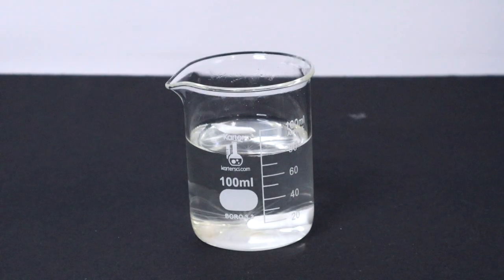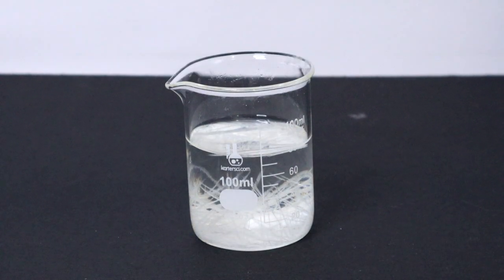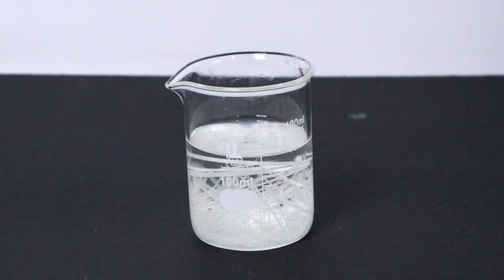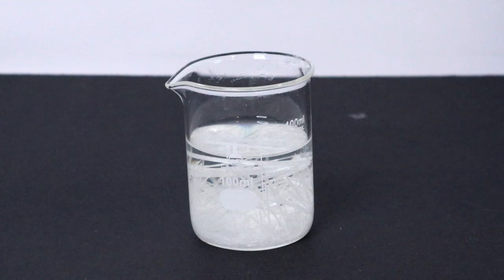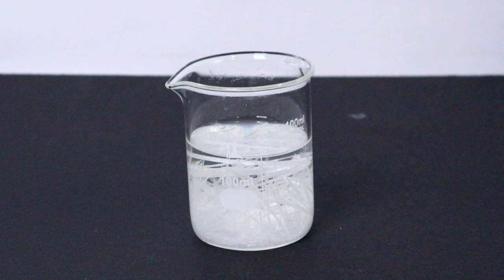From the time-lapse, you can see beautiful needle-like crystals of hydroxylamine hydrochloride forming. I can also confirm this recrystallization procedure works well to clean up dirty yellow hydroxylamine, which I obtained in previous runs.